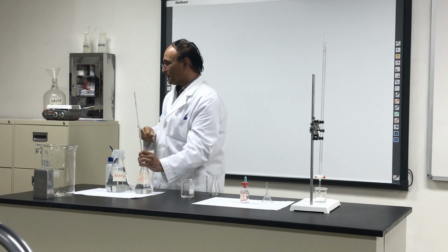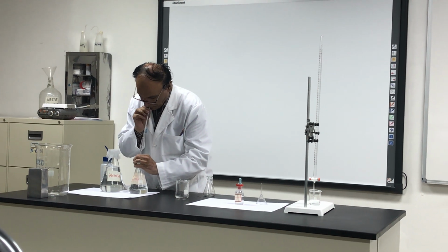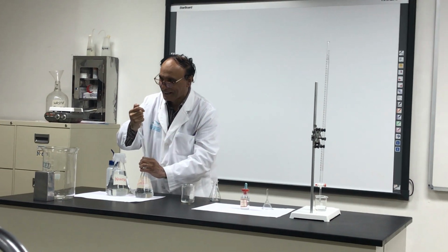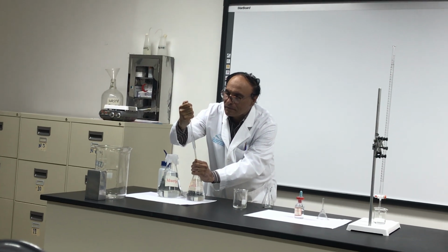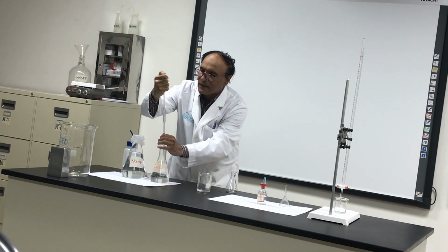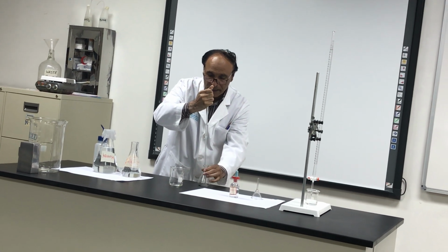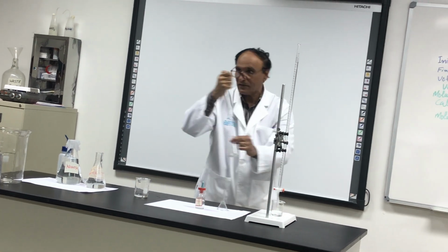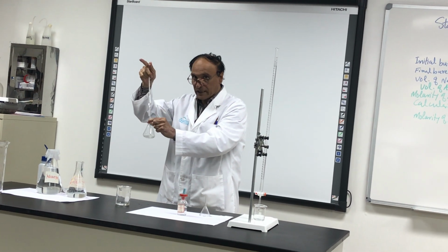So what I have to do? Drink it again. Take it again. So very slowly, like this, very slowly hold it on the line and put it inside. This should be close to you. Nobody will take it and search and ask, where is the flask? No. Take the flask with you there.